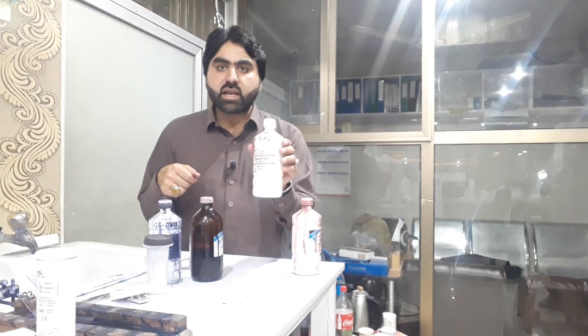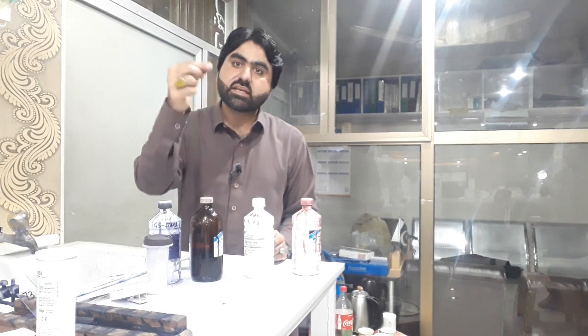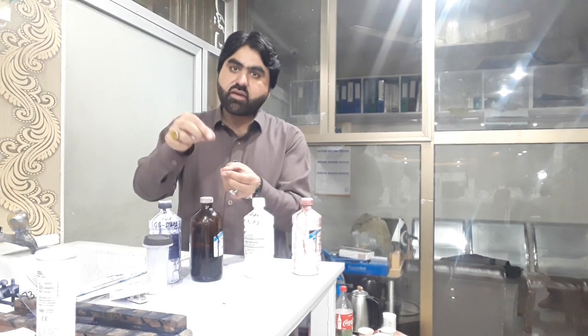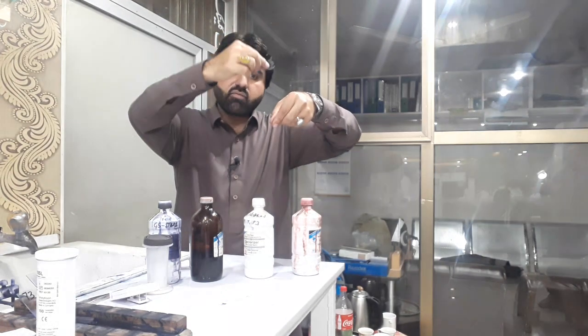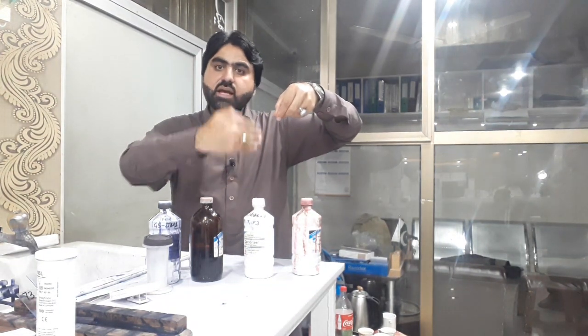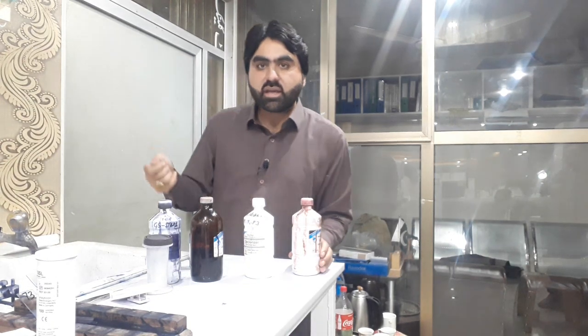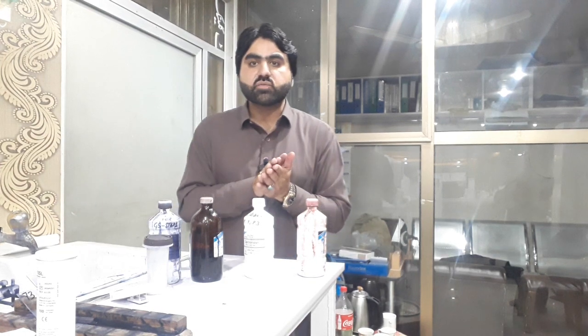Then add the decolorizer drop by drop, or flood the smear for five to ten seconds. You can add drops falling from above going downward along the slide. Rinse the slide with tap water again, then finally add safranine for one minute and rinse with tap water. Air dry the smear and examine under the microscope.